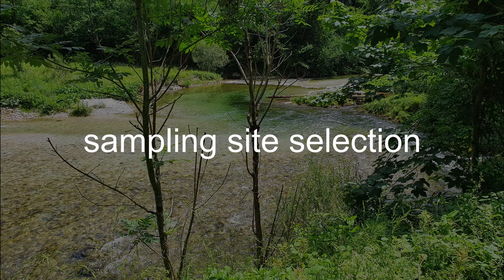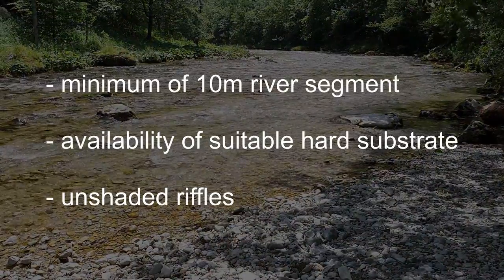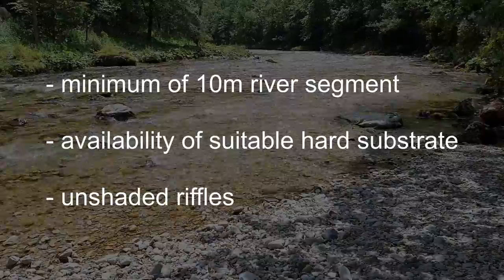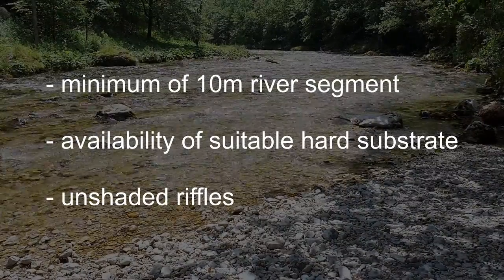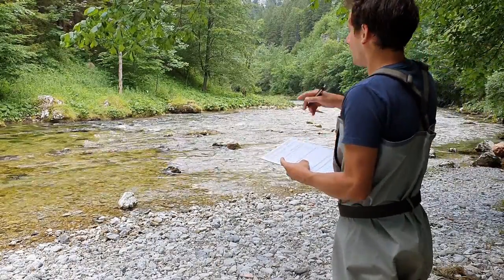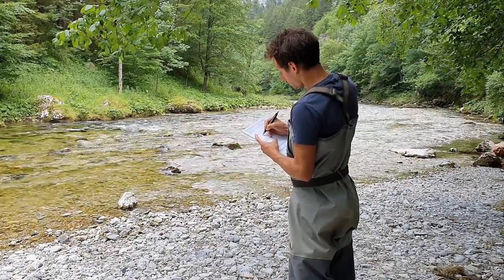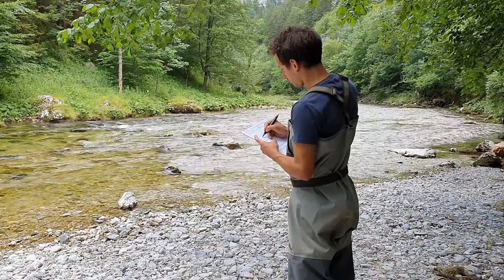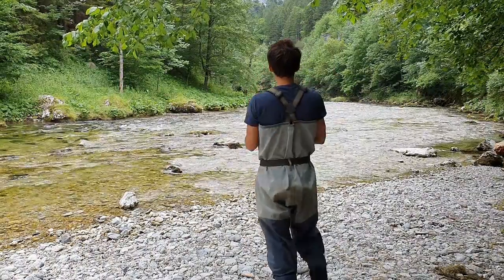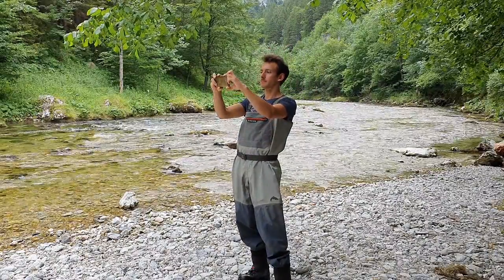For choosing an appropriate sampling site, several criteria should be fulfilled. The river segment should be about 10 meters long, but also longer stretches may be appropriate. Hard substrate, preferably cobbles, is available, and unshaded riffle sections with maximum sunlight are present. Prior to sampling, a detailed description of the site indicating location, coordinates, widths, substratum type, percent cover of macrophytes, percent of shading and other specific details depending on the project and monitoring activities is required. A photographic record of the sampling site is also important. This information serves later on for data interpretation and to help other researchers locate the site.